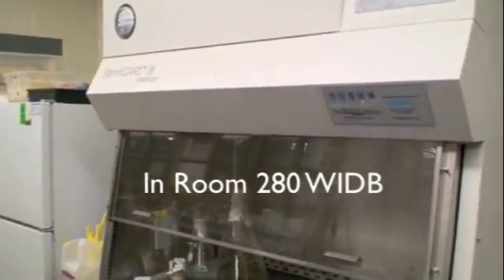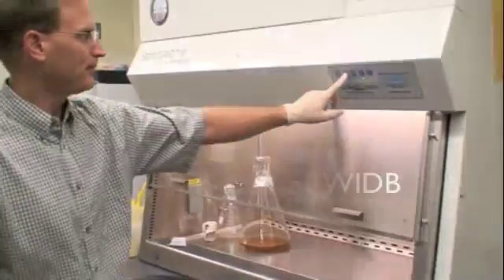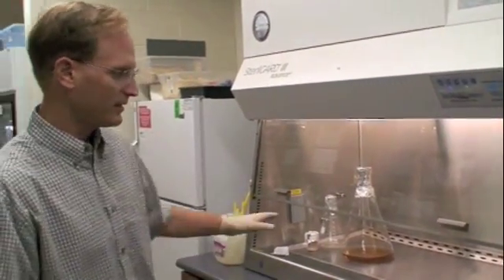So, this is the cloning hood where we do all of our work, this is the sterile hood.